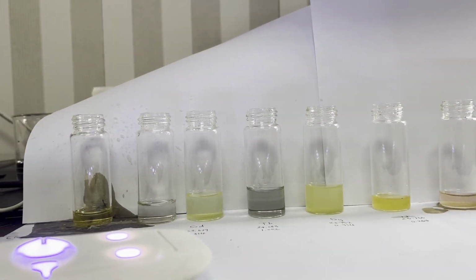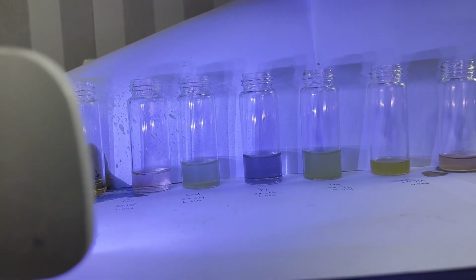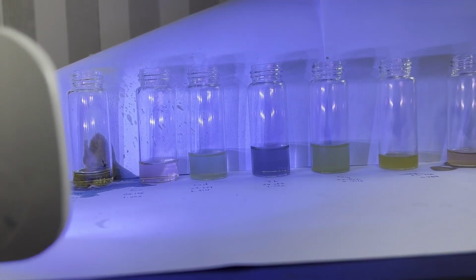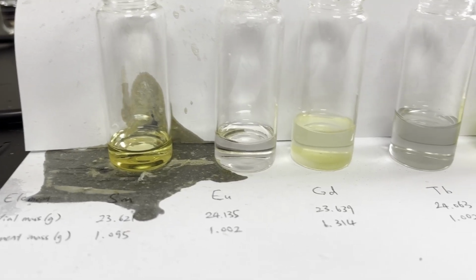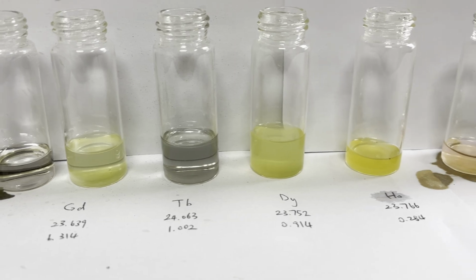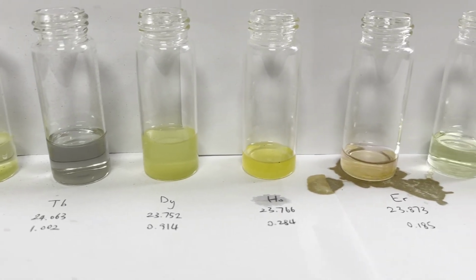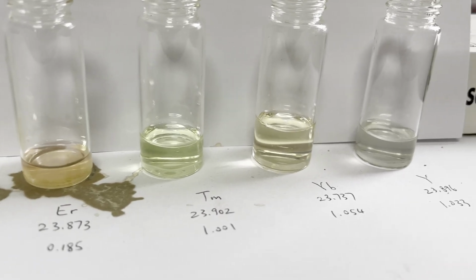The final test I did was shining UV light on the solutions to observe the fluorescence. Europium has an extremely strong red fluorescence, and terbium has a slightly weaker green fluorescence, but I saw neither. So it's either my UV is at the wrong wavelength, or it's because my stuff isn't pure. But judging from the vigorous reaction of europium with water, it's more likely that my UV light is bad and I should get a better one. But that's for another project.